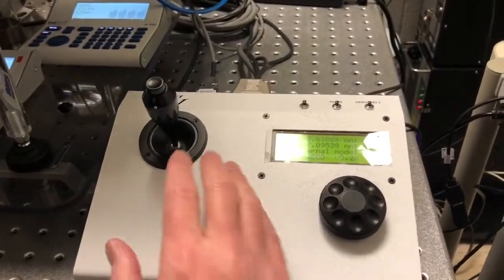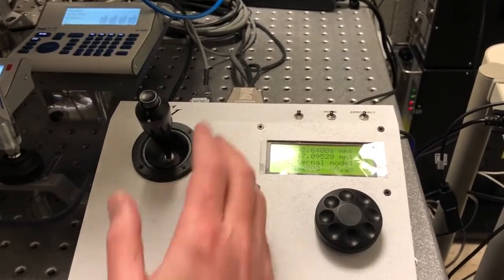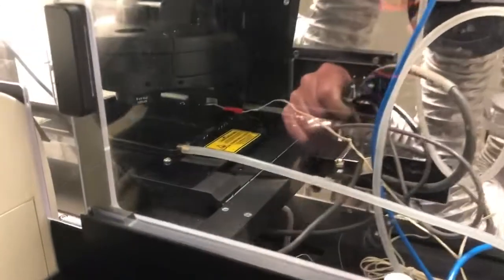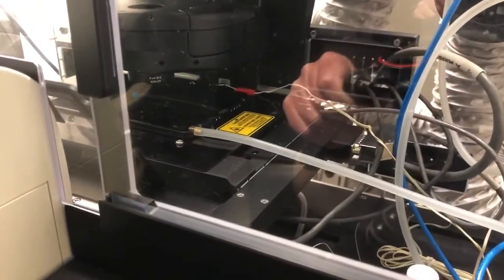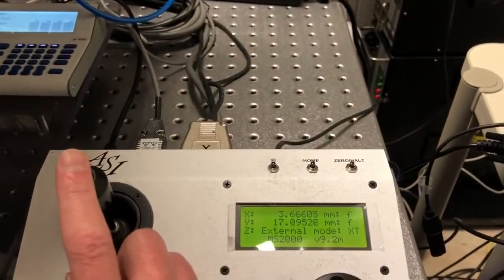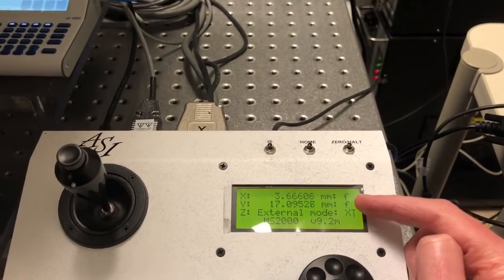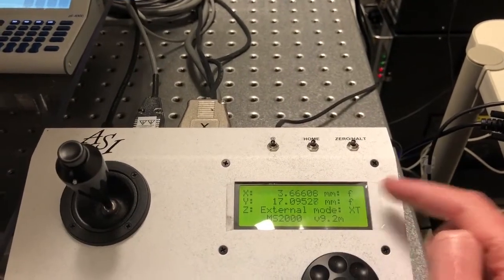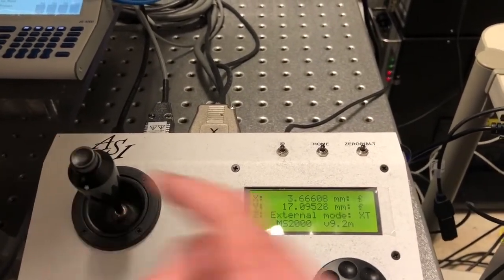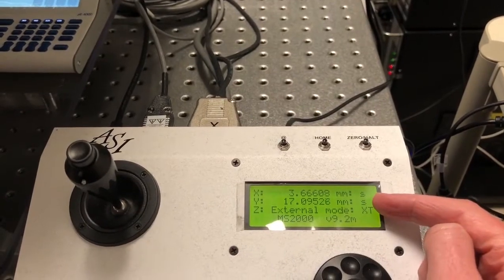To move in XY we have this motorized stage where deflecting the joystick moves the stage with the sample on the microscope. Pressing this button toggles between a fast mode, indicated by an F, or a slow mode, indicated by an S.